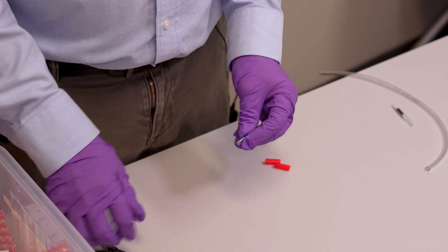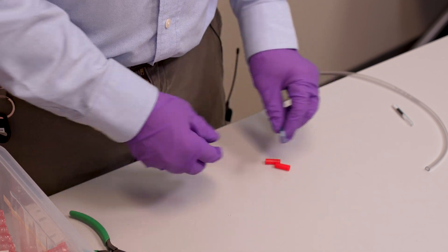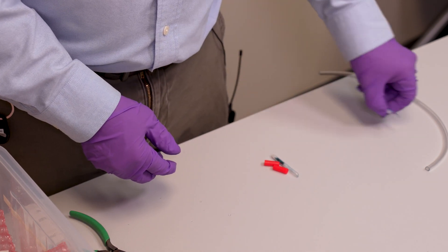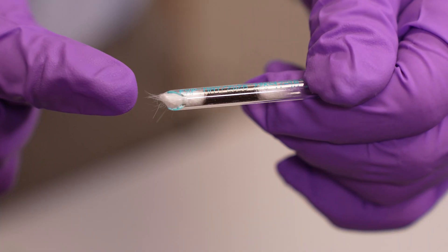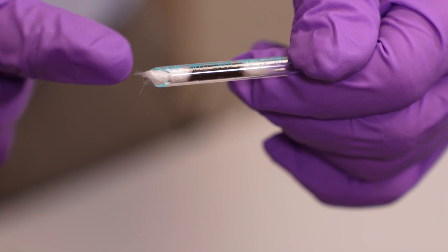Just like that. One thing you don't want to do is break off too much, because then you'll have breakage in the tube and you can impact your sampling event.